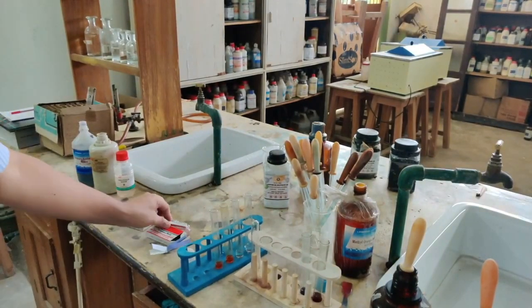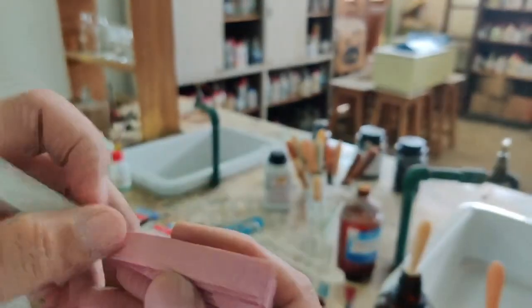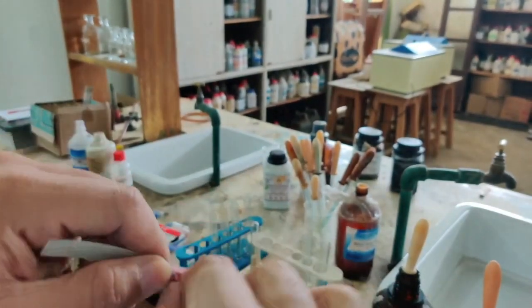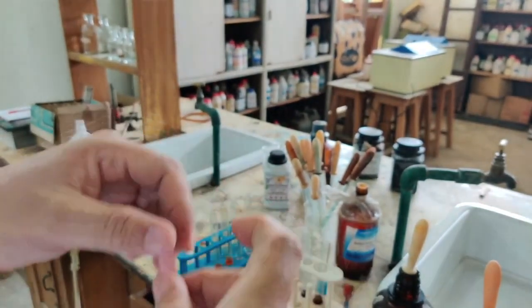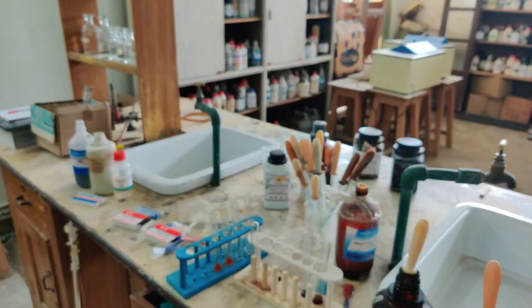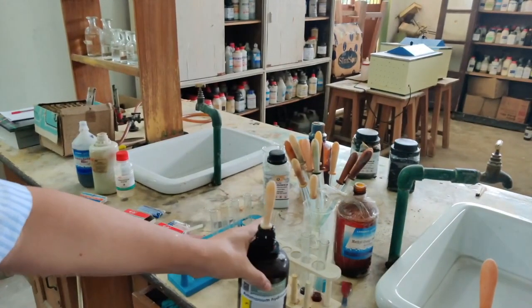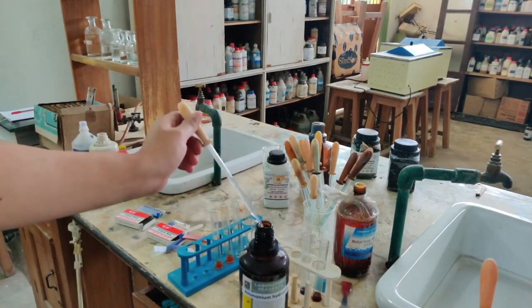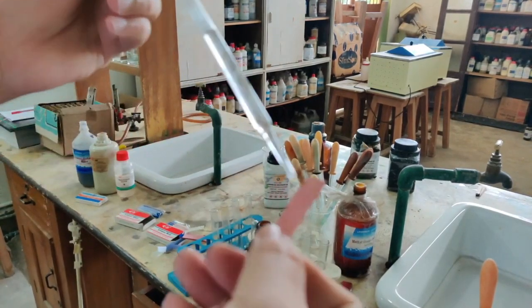So I am going to take now the red paper. You can see red litmus, this is red litmus paper. If I am adding an acid here, nothing will happen to this red litmus paper, because red litmus will turn to blue when it is a basic solution. So for a basic solution, I am using ammonium hydroxide. Here is ammonium hydroxide. If I am using this ammonium hydroxide, now you will see how the color will change. So here let me add it dropwise.